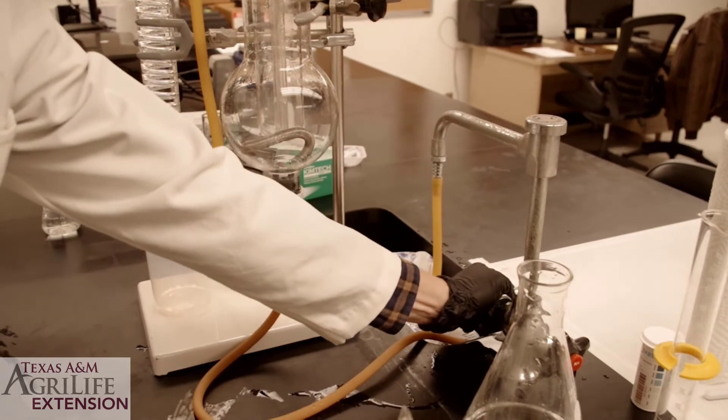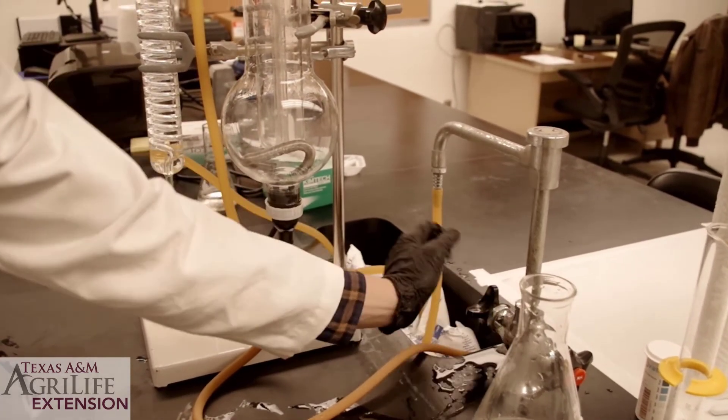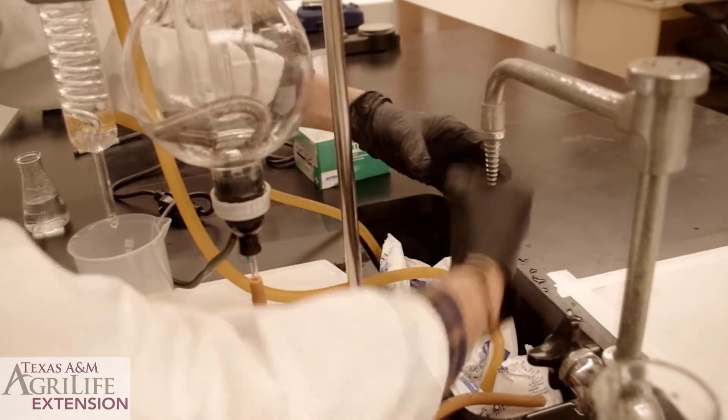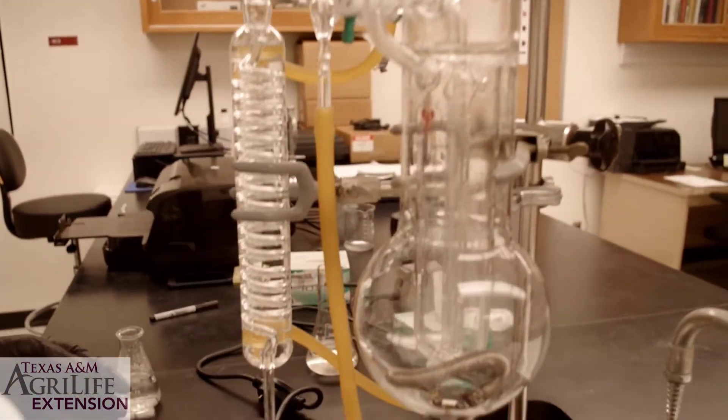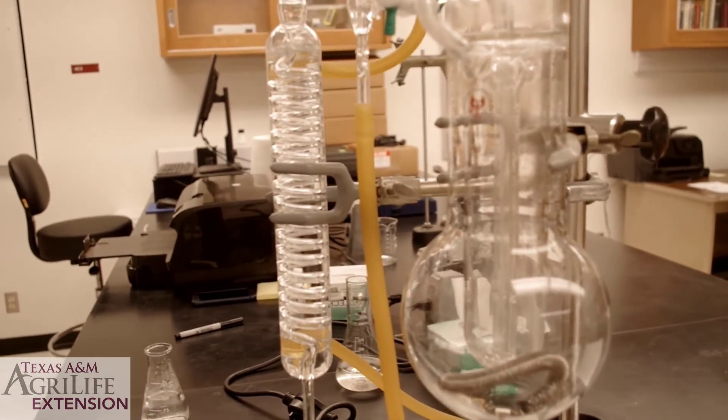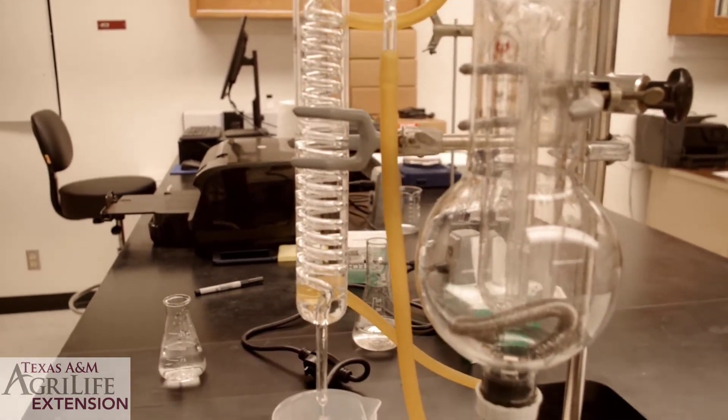Now turn the cold water tap off so that you can drain your cooling chamber. In order to do so, disconnect the hose from the tap. The water will now drain into your sink.